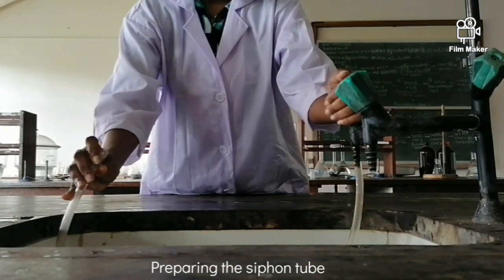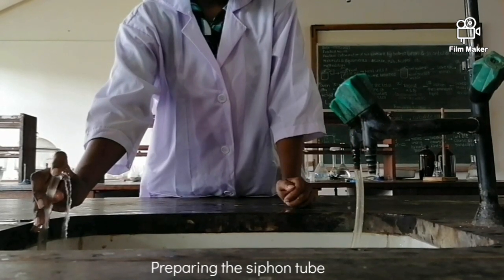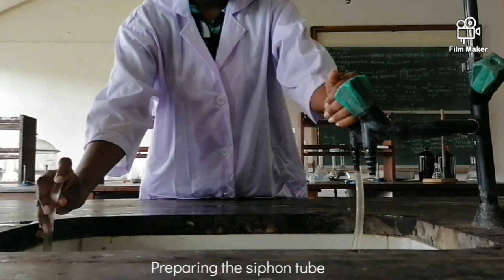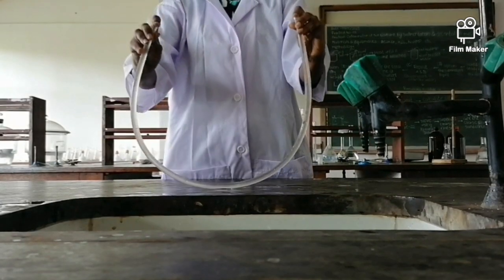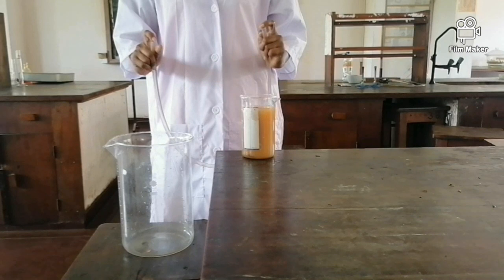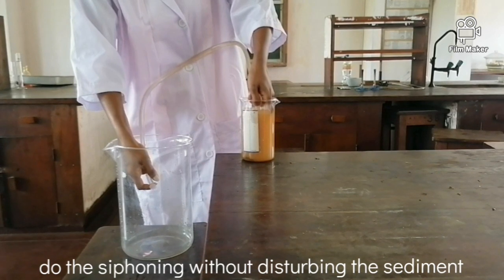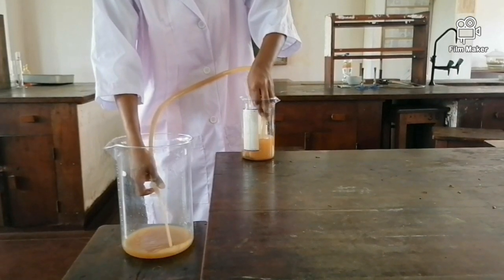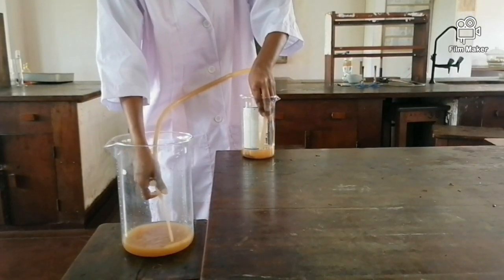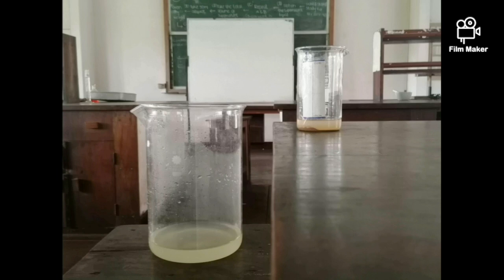A water-filled rubber tube is used to siphon the supernatant. While siphoning, make sure that the 600 ml beaker side of the rubber tube is released first. It is very important not to disturb the settled sediment. Also, do not forget to transfer all the supernatant that has entered the rubber tube. Repeat the process until the supernatant is clean like water, and keep the residue for the silt calculation.